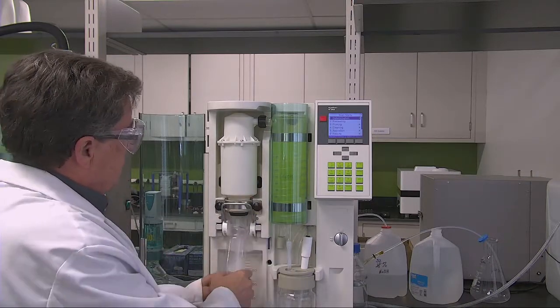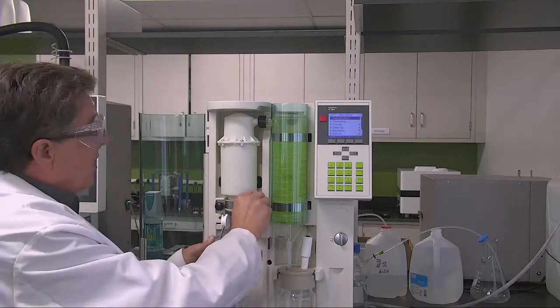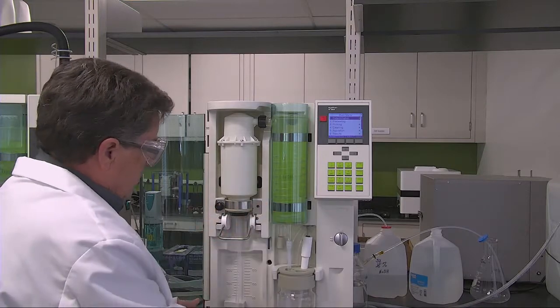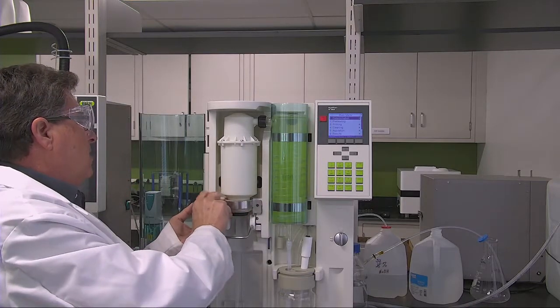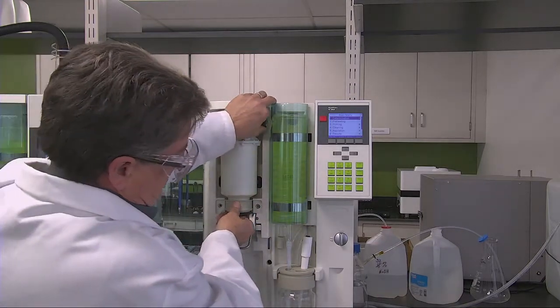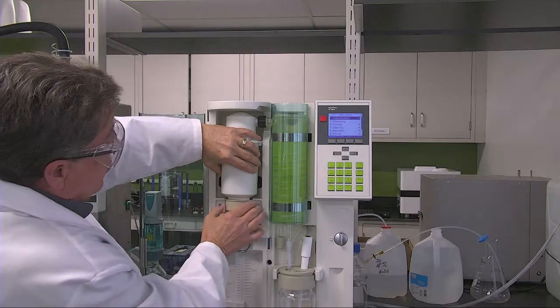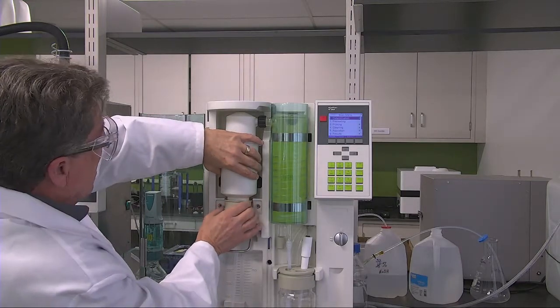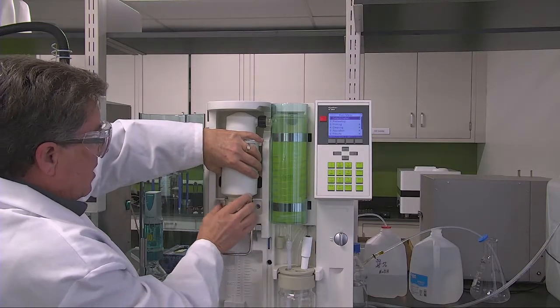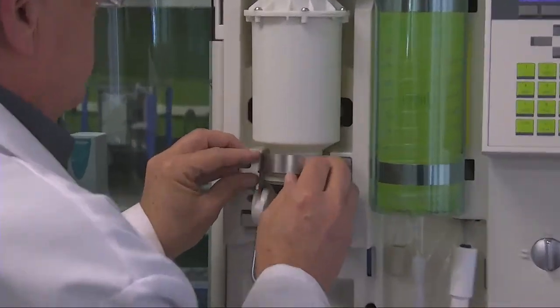To change it, it's a simple process. Take the tube off, then loosen these screws. Take the bracket off. At that point, this is accessible so that you can undo this. Oh my, that is loose. You undo this nut and you change the bung, put a new bung on, tighten that nicely, and put the system back together.